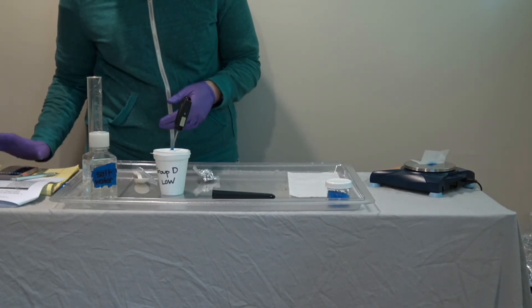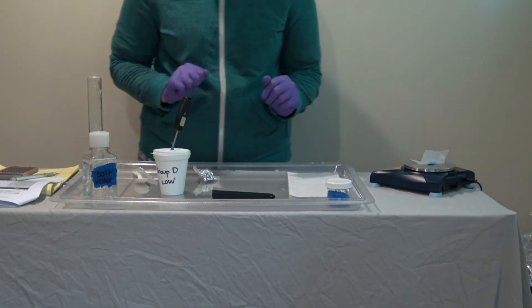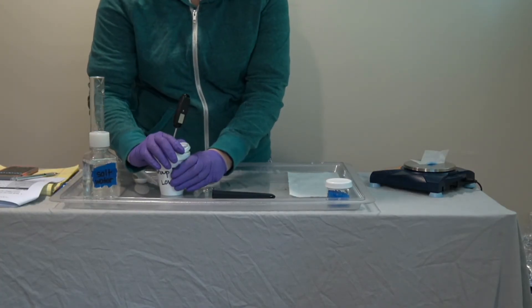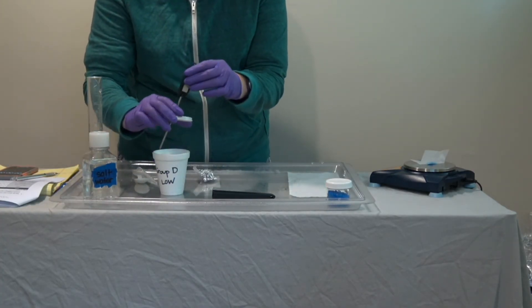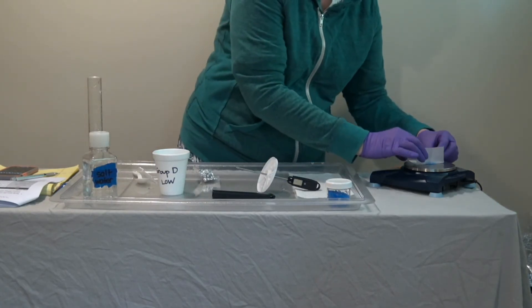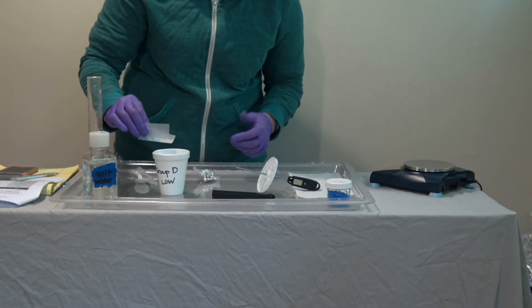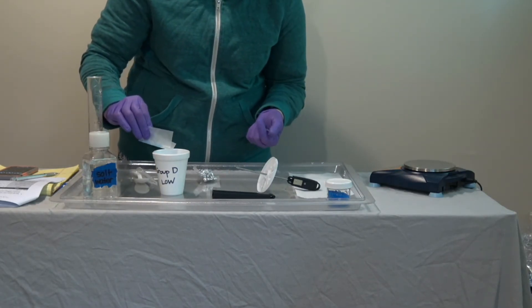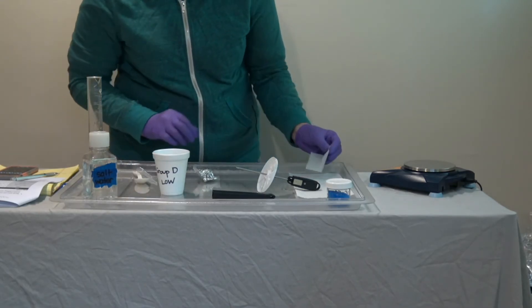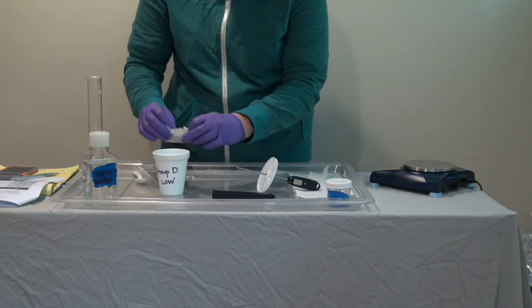Make sure the clock is ready to go. My starting temperature is still 19.1. As a team, students will quickly lift the lid off the cup of salt water, first pour in the root killer, and then follow it with the aluminum foil.